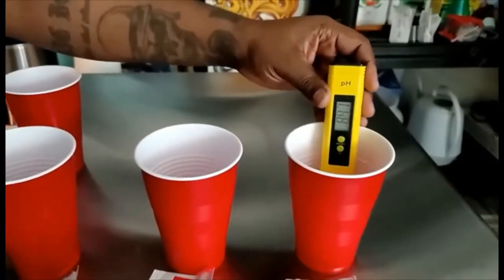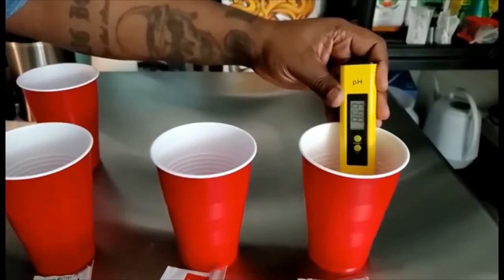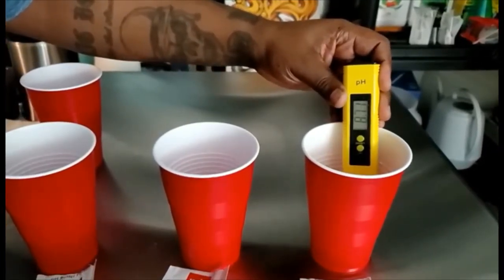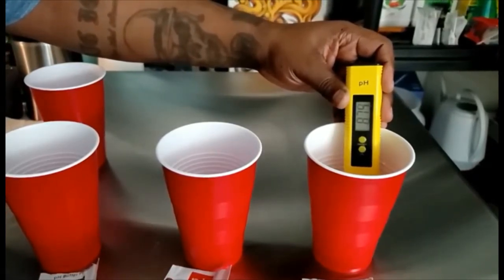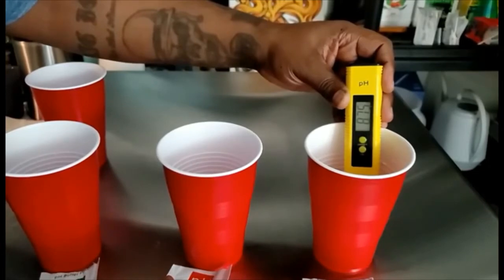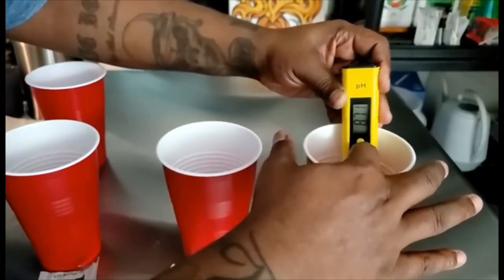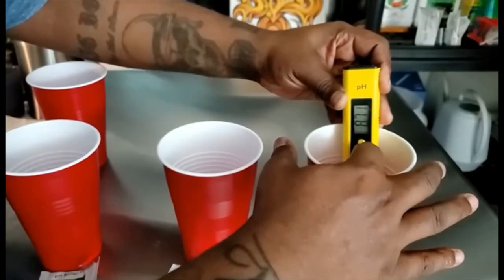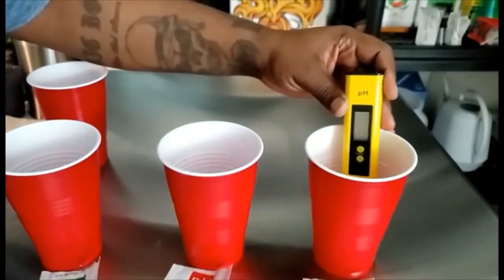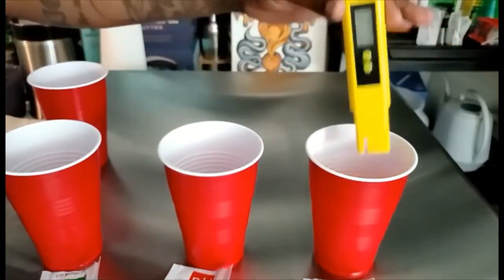Now we're at the 9.18 solution. Make sure your meter is on and put it inside the solution. This time we need to wait and let the reading stabilize. Once it does, hold the calibrate button down for five seconds, release it — it's going to flash three times and you're going to see 9.18. Clean the electrode with distilled water and dry it.